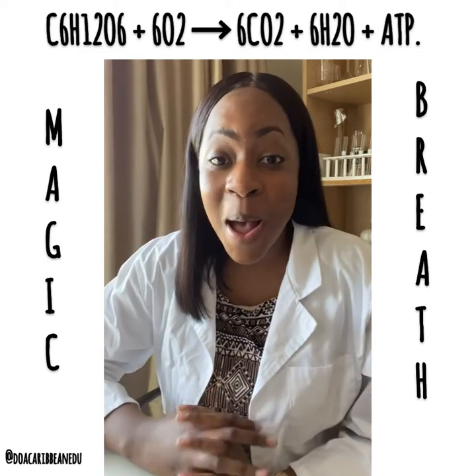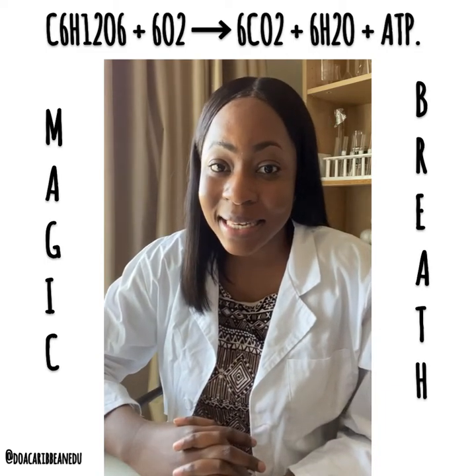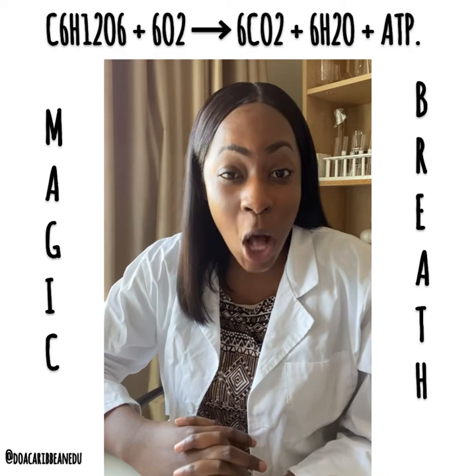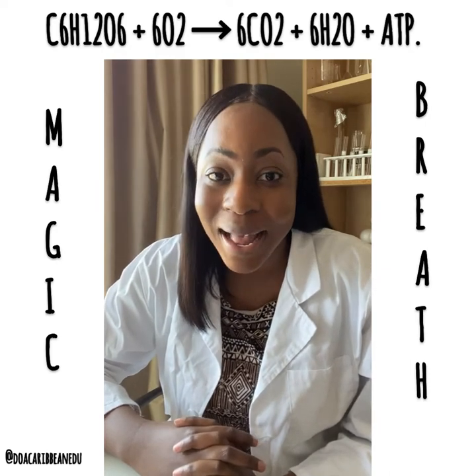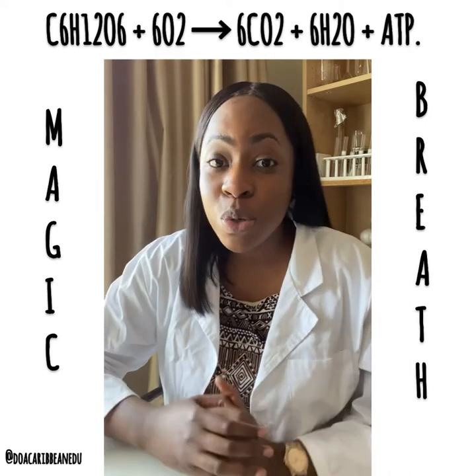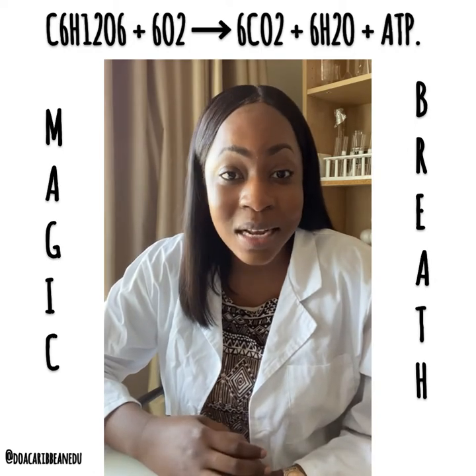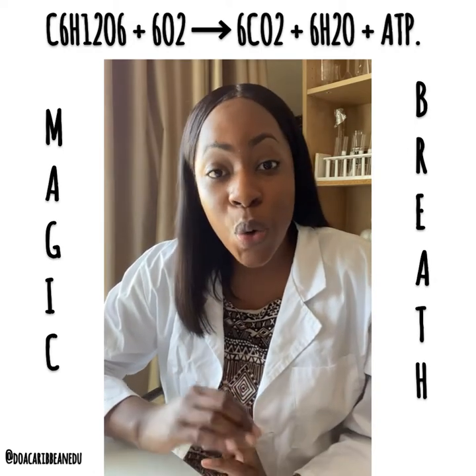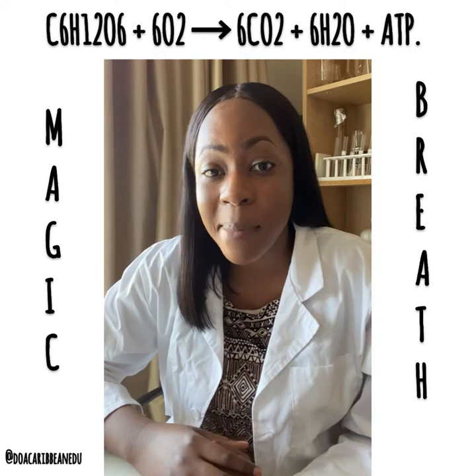Now carbon dioxide is slightly acidic, and when it is dissolved in water, it forms carbonic acid. Now we're going to use phenolphthalein, an acid-base indicator, to show the acidity of carbon dioxide.